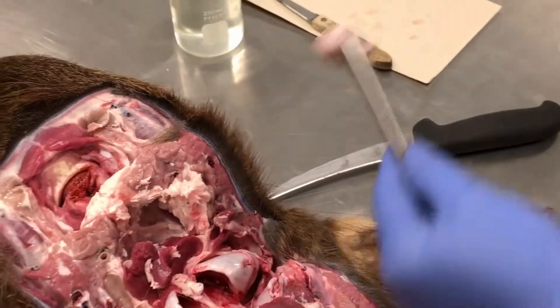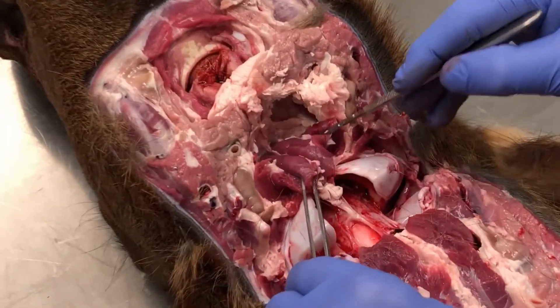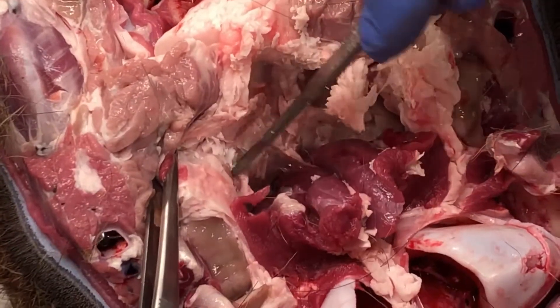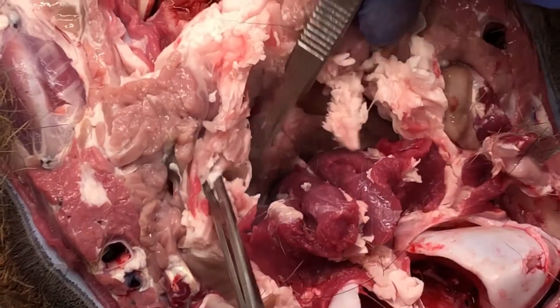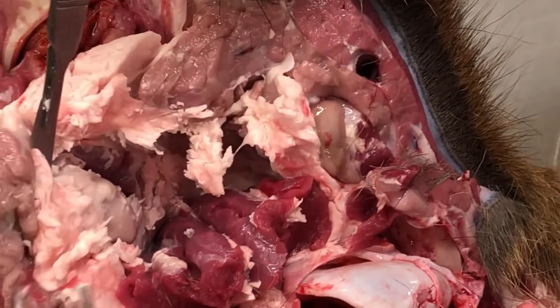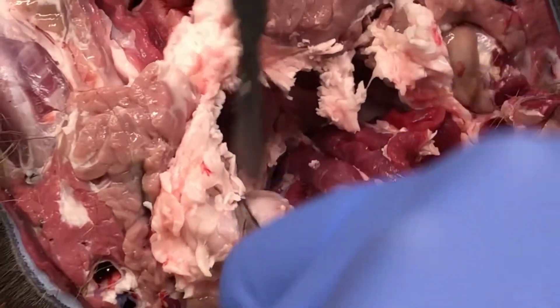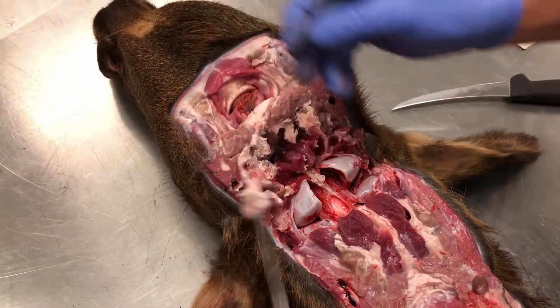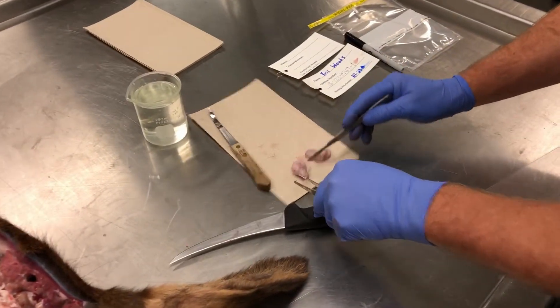And there's one of your nodes. Now keep these two muscle tissues in mind and look just above them — you're breaking them apart, and the other one is just going to be on the opposite side. If you just cut down in here and do some searching, there's your other node right there. Just kind of peel that out, clean it up a little bit, and there you have your two retro pharyngeal lymph nodes of this animal.